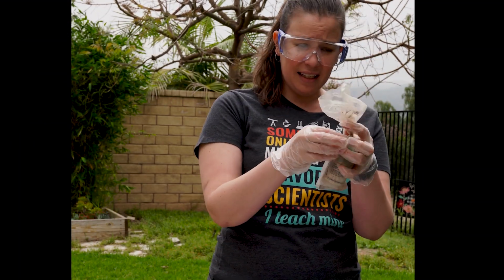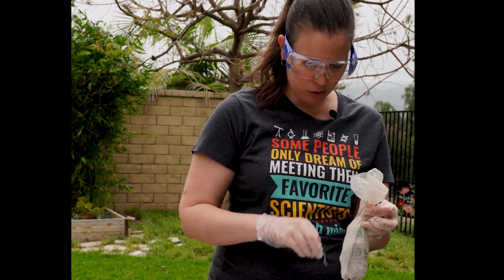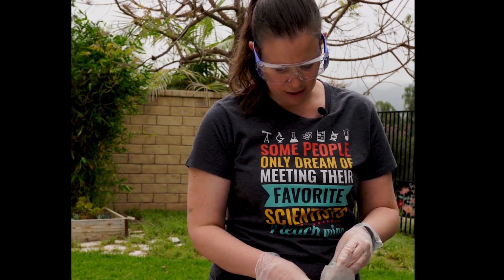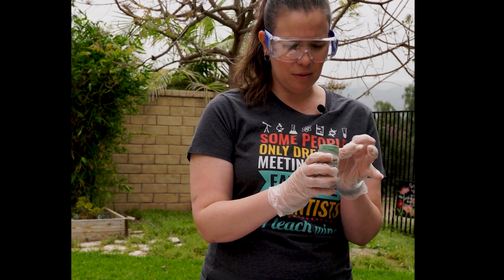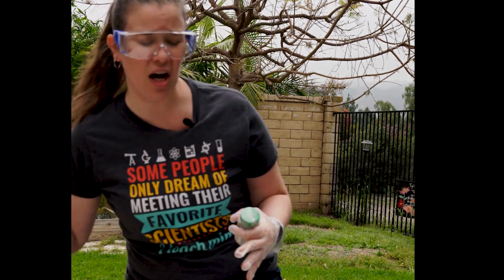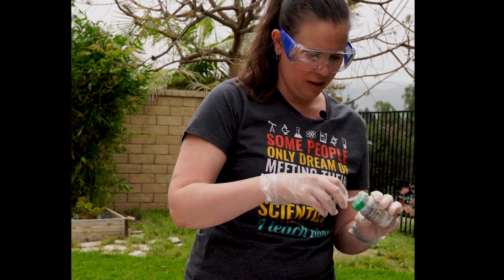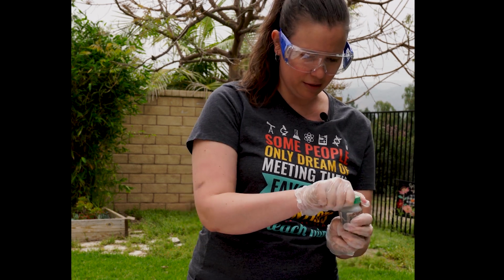And then that little baggie is tied off from the air. So we're going to have to unscrew a little bread tie, twisty tie around the bag in order to get the chemical bottle out. And then there's another layer of protection to protect it from the air, something called parafilm. So this goes around the outside, the top, in order to make the bottle itself airtight. So we're going to have to get that parafilm off in order to be able to even open the chemical bottle.